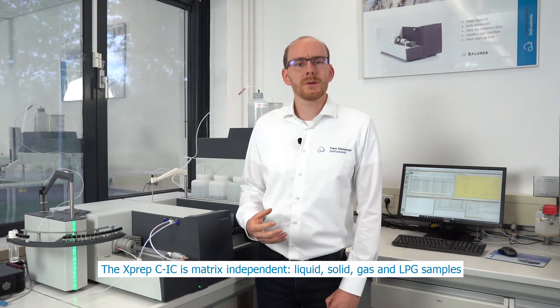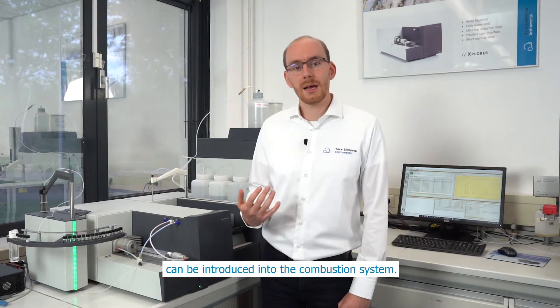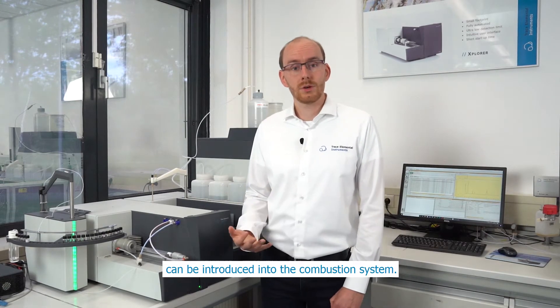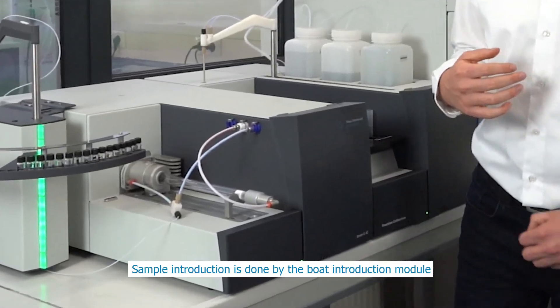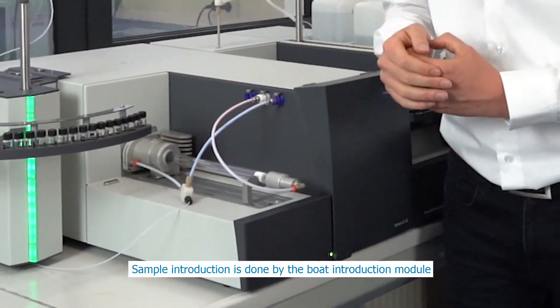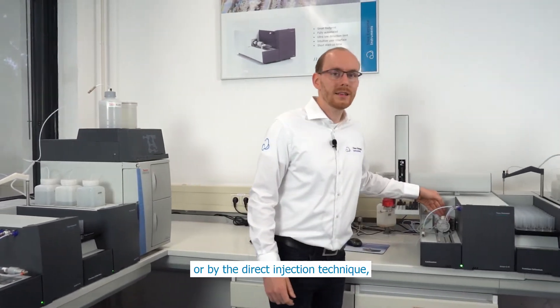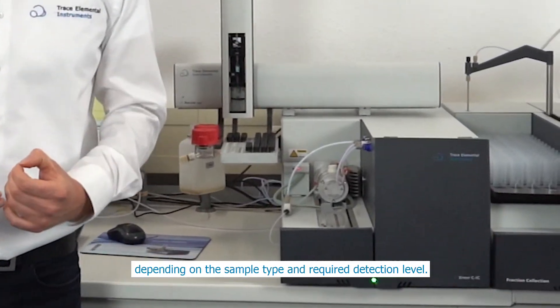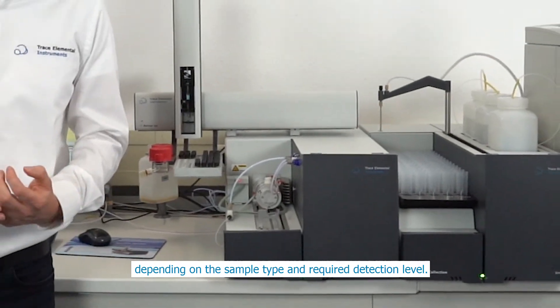The X-PREP CIC is matrix independent. Liquid, solid, gas and LPG samples can be introduced into the combustion system. Sample introduction is done by the boat introduction module or by the direct injection technique, depending on sample type and required detection.